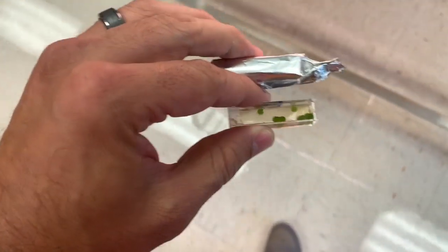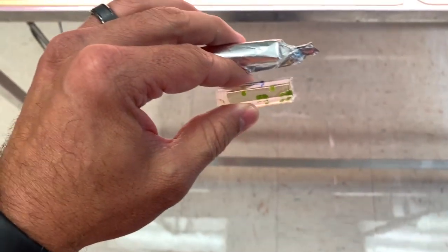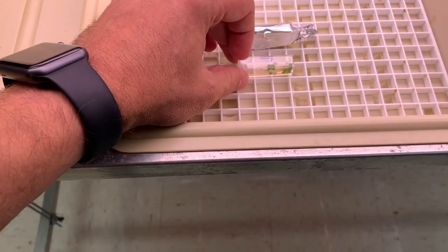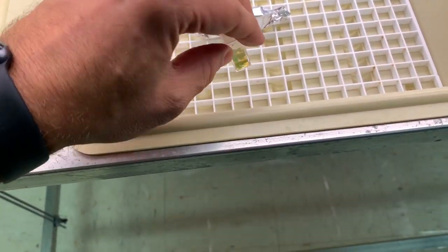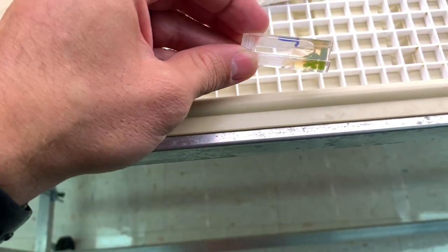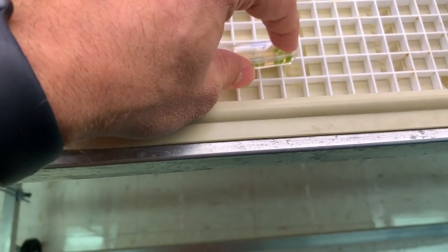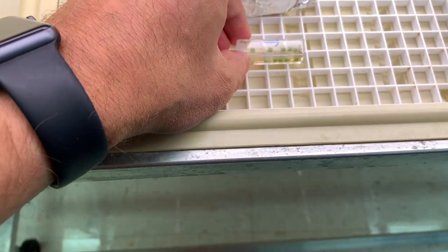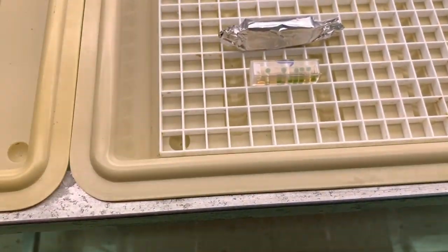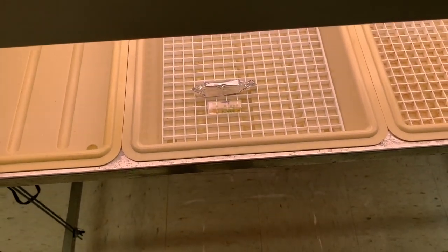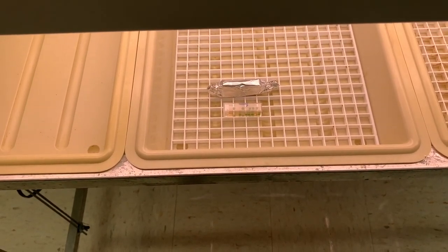Make sure you know where you put yours, and it's really important. As you can see here, I get algae beads sticking on the side here. You want them all to be laying as flat as so they're all getting equal amount of light. They're all floating on the bottom and they're all laying flat and they're in the liquid. And then you want to leave it in there. So we're going to come back and check on these in five minutes and check the change in the pH.